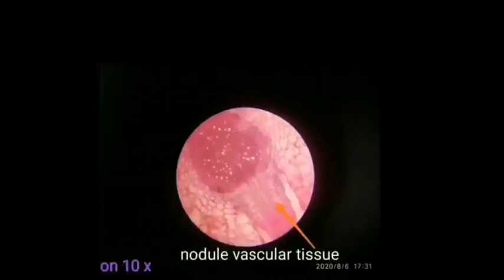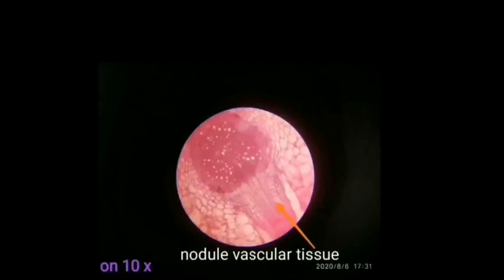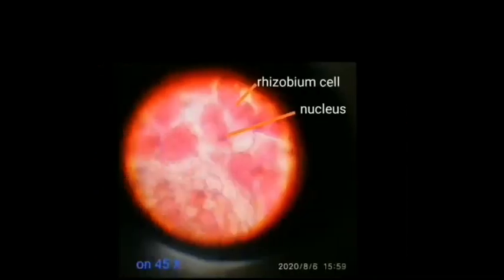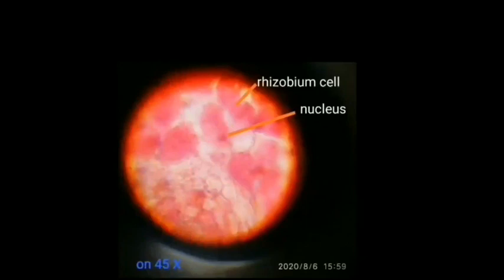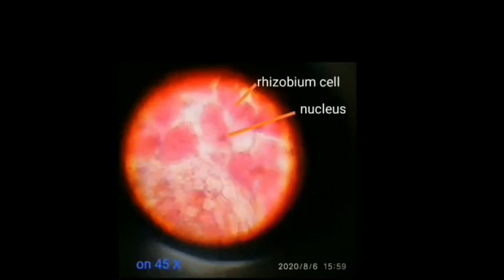This is the section of the root where we can see the nodule vascular tissue. This is the section of the rhizobium cell, where we can see the rhizobium cell as well as the nucleus on 45X.